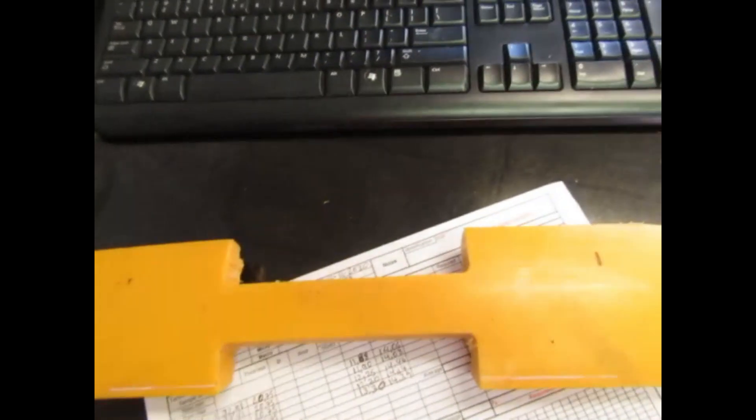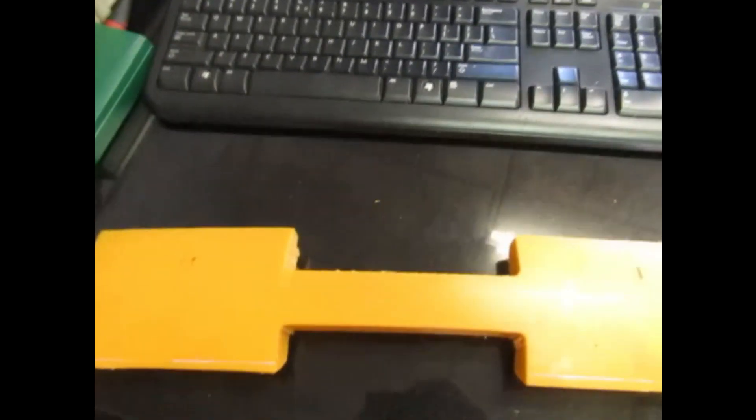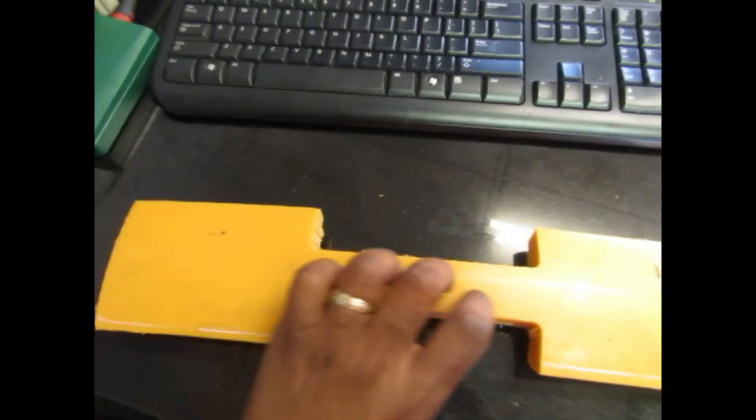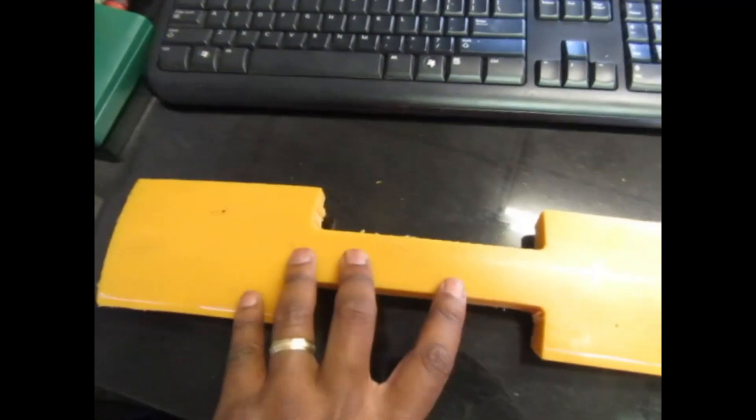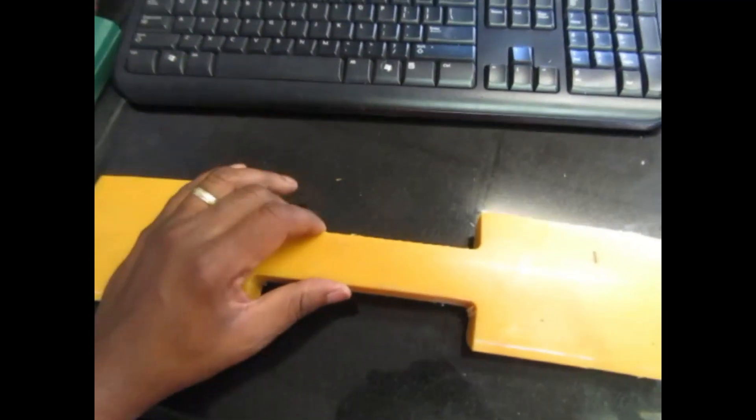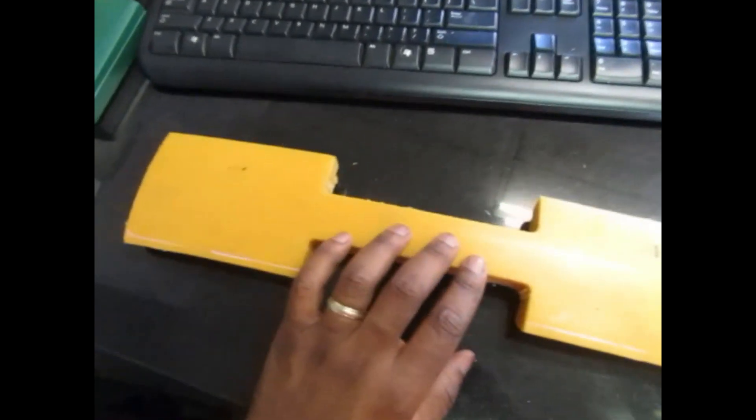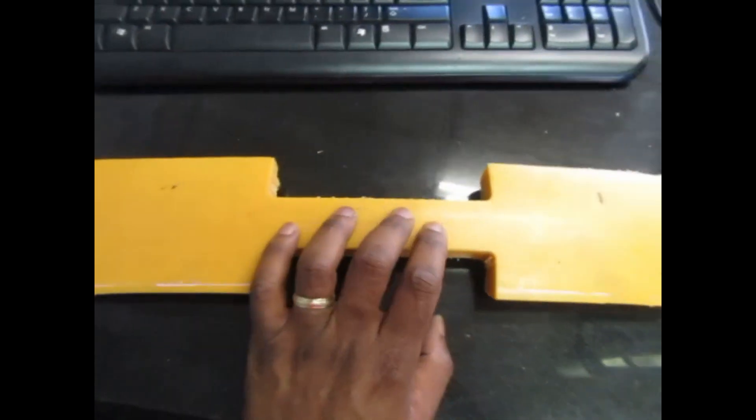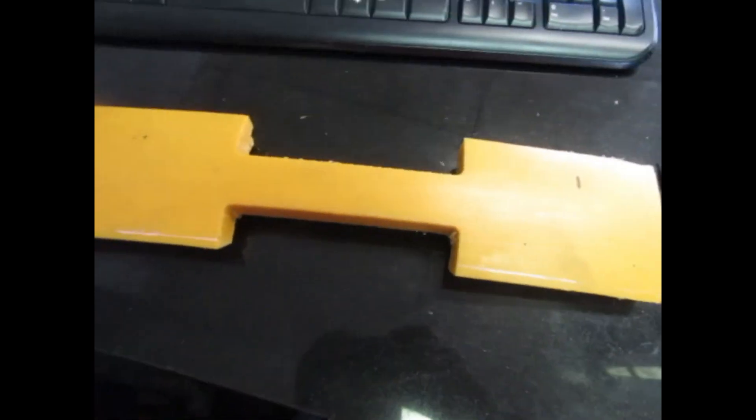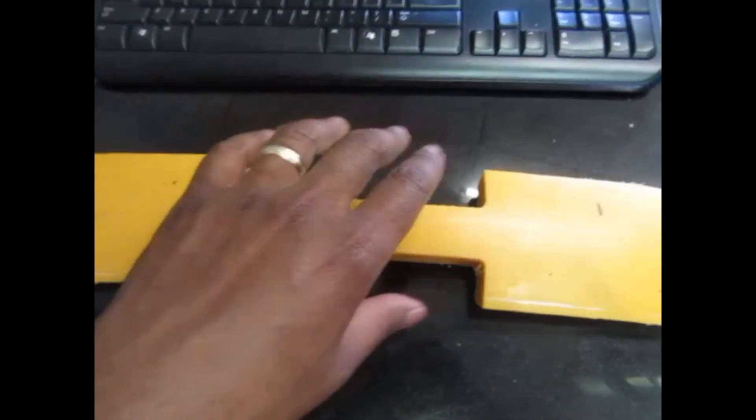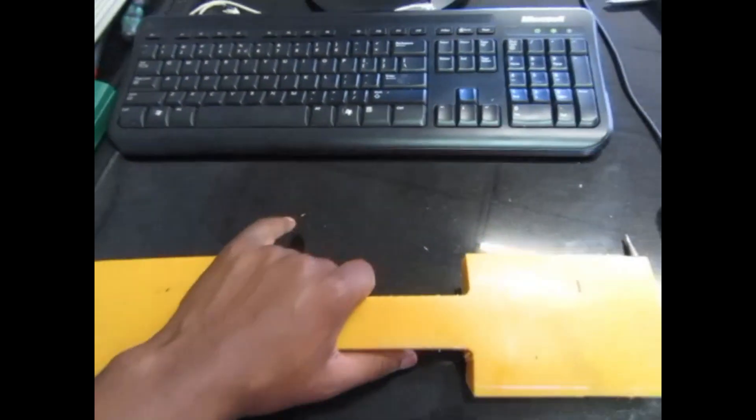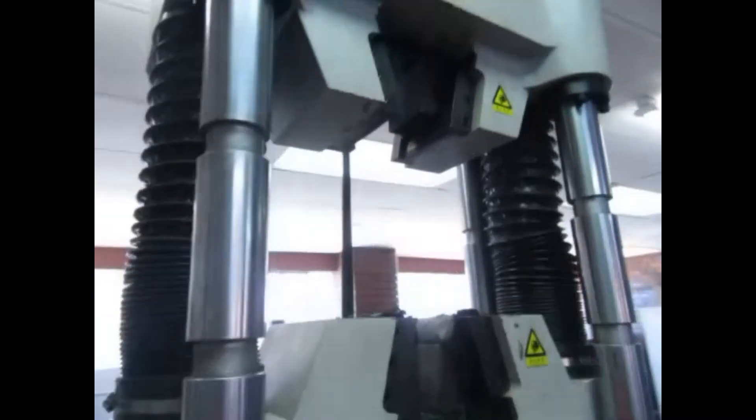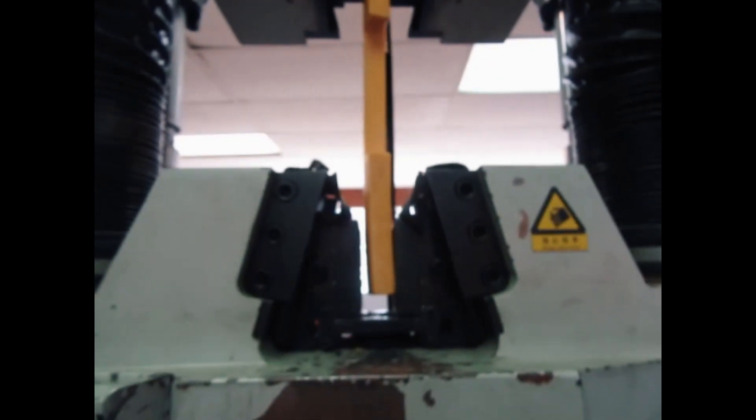So this now is a tensile which is just a full parent metal. There's no weld on it. So we're gonna do the same thing that we did the first time with the one with the weld. First I'm gonna have to grab my sample in my test machine.